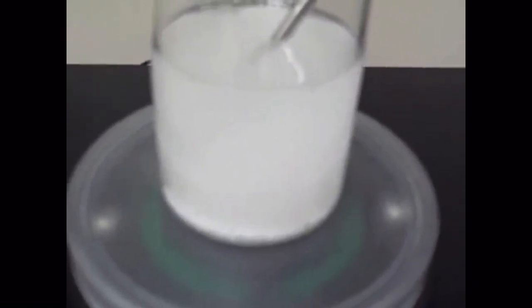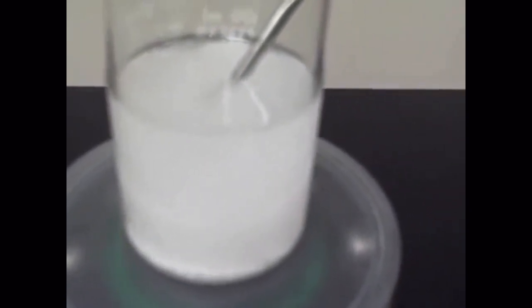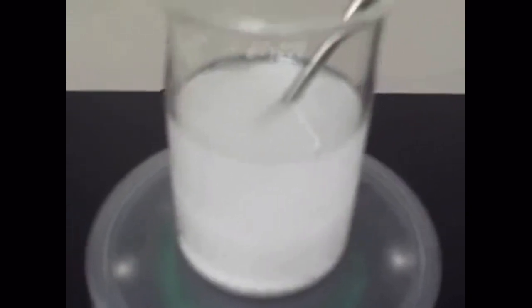130 seconds. So when you're looking at this data, be sure to know how to write it on your chart. So that last reading, I did not say because it had not reached 130 yet, but at 130 seconds, I got 50.8 degrees Celsius. So that's what's going to go on the data table, 50.8.